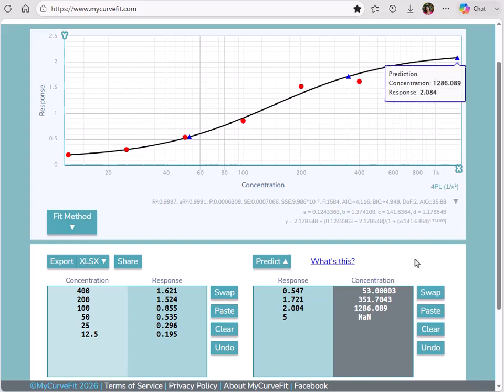So now our third prediction does show an extrapolated concentration. Looking back at the predict table, let's review the calculated concentrations for each of our samples. The first interpolated result is quite similar, 53. The second extrapolated result is pretty different though, 800.25 compared to 351.7. So this begs the question, when is it okay to extrapolate data, and what is a usable extrapolation?